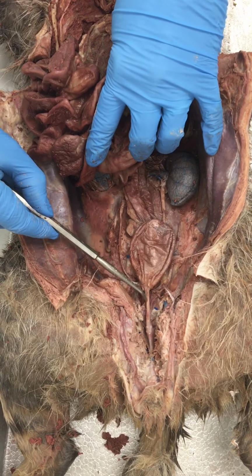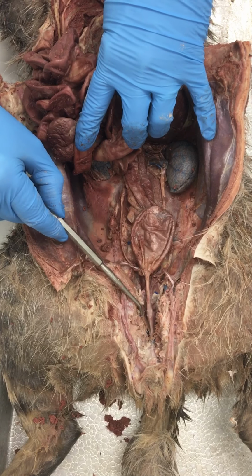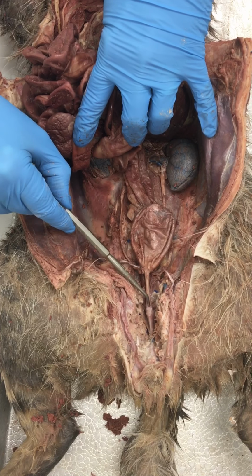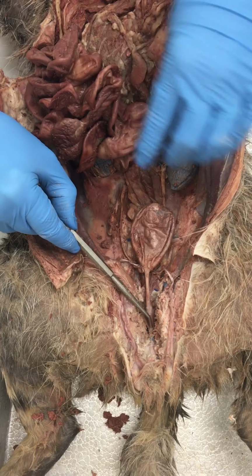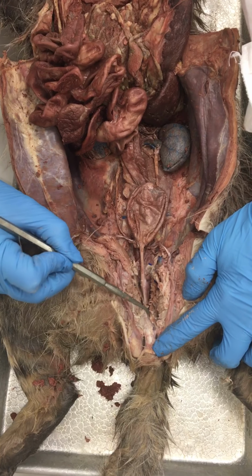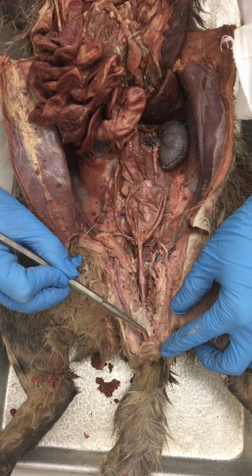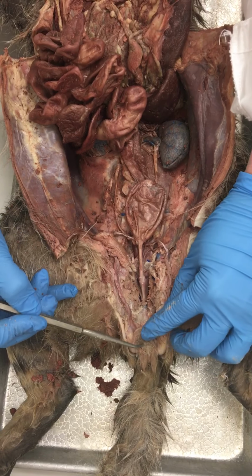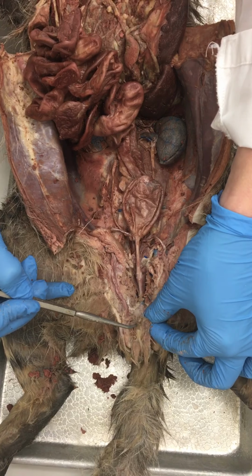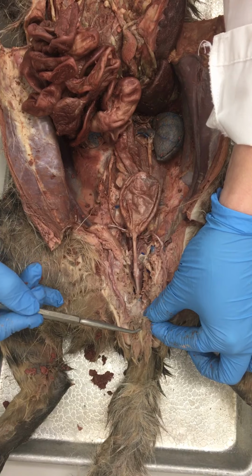This is the urethra, and it will go down through the pelvis. We've cut through the front of the pelvis right here and removed it, and the urethra continues until it enters the sheath of the penis, which is this white tube-like structure right here, and eventually the urine will drain out through the external orifice, which is this tiny little opening right here. I'm pushing the tip of my probe in it.